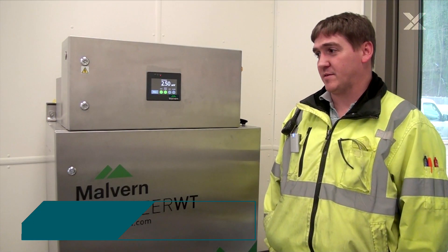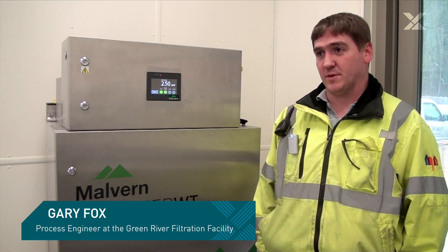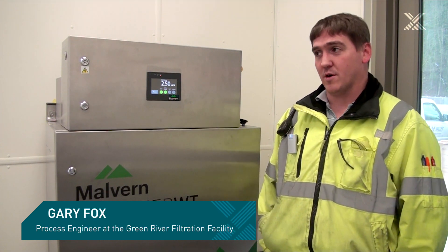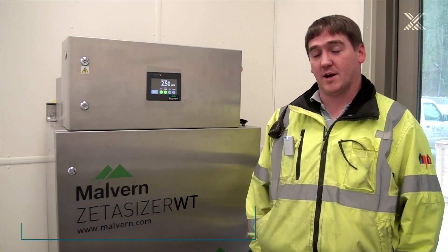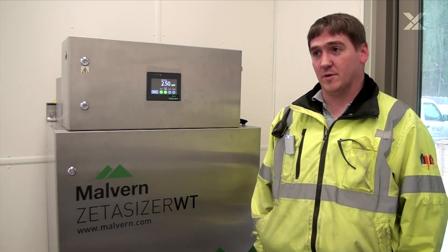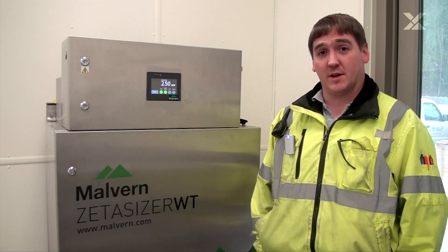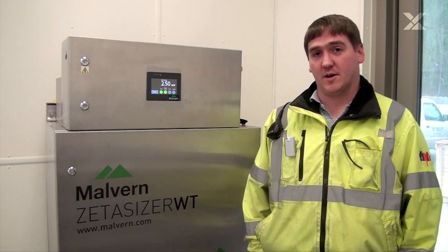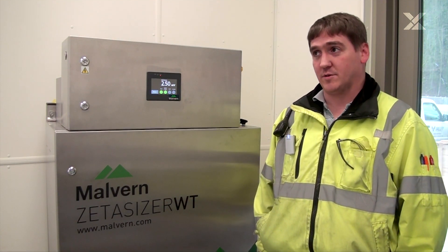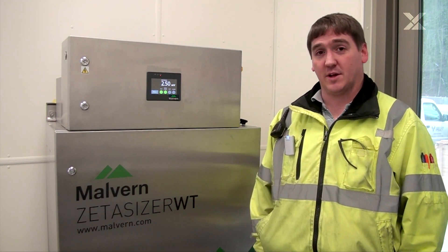We have been running this as the benchtop instrument for a couple of months now and we're excited to put it online and actually have this available in real-time data through our SCADA system to help us predict our coagulant dose and to better understand that we're actually doing the right dose based on the particle destabilization of the plant.